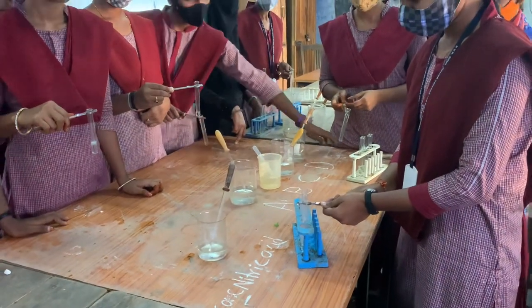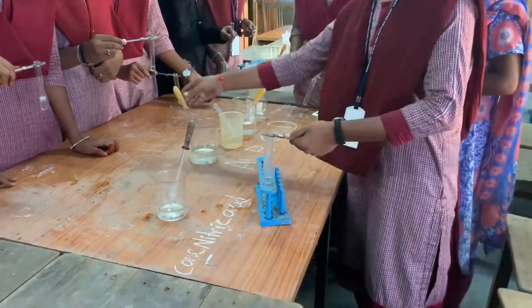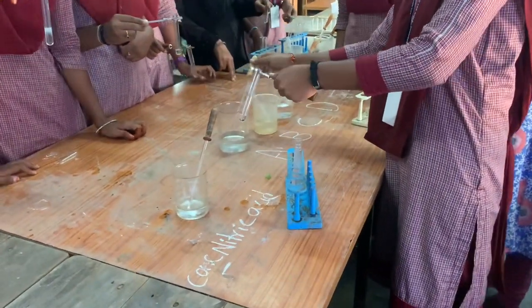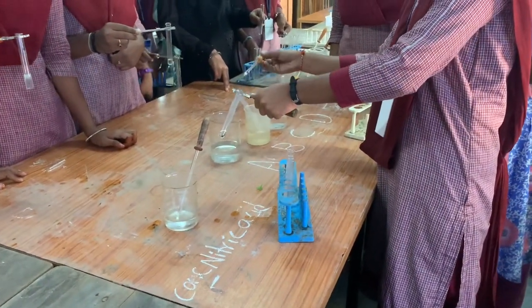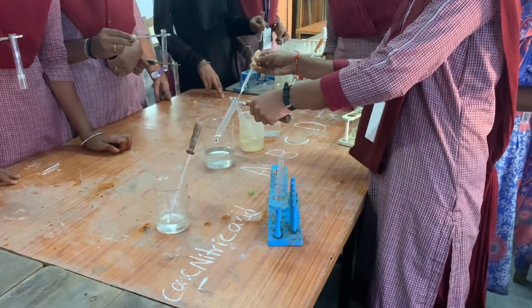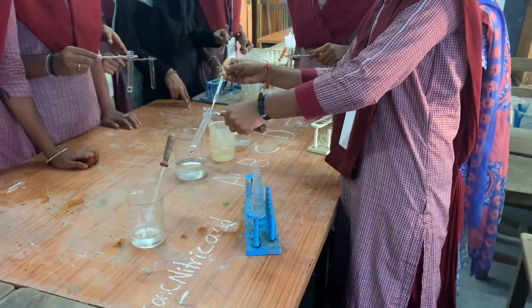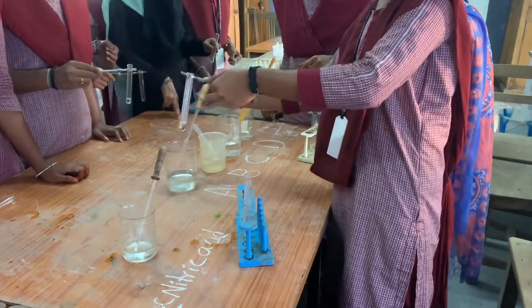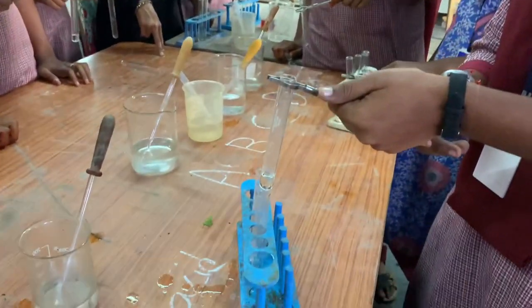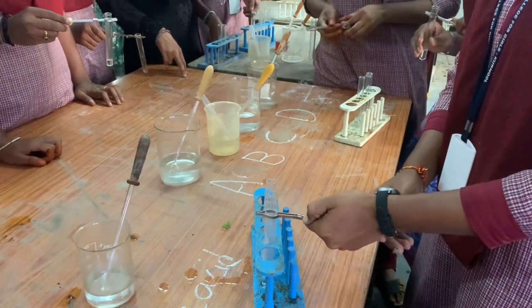After taking 1 ml of concentrated nitric acid, add sample A very carefully through the walls, slowly and steadily. Then observe for the formation of any ring. A ring is not formed, so albumin is absent in sample A.